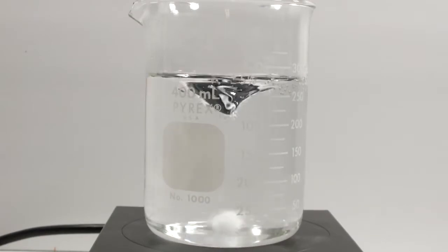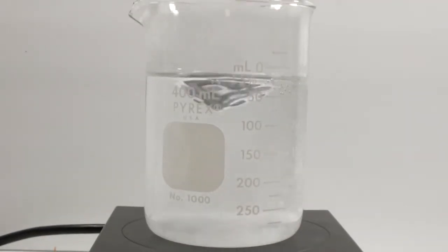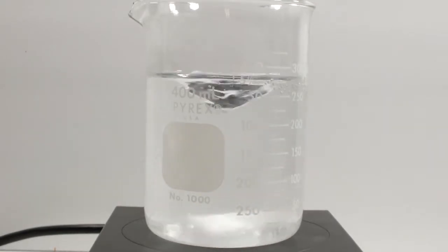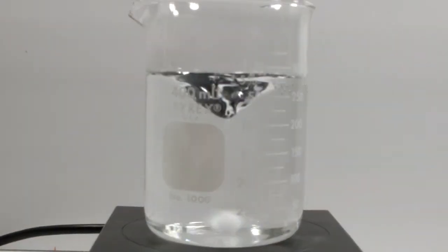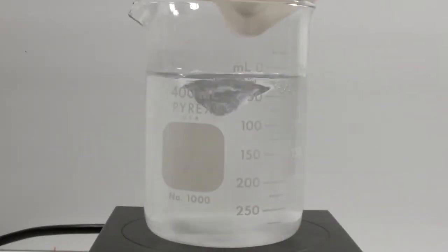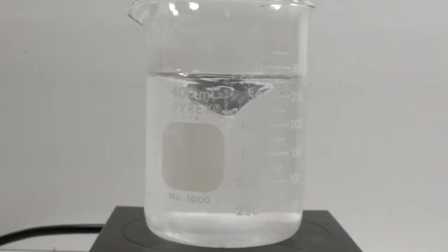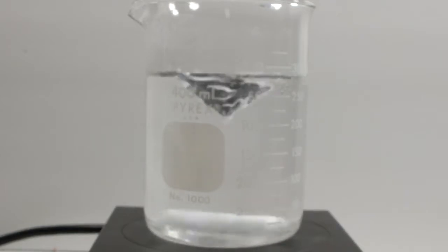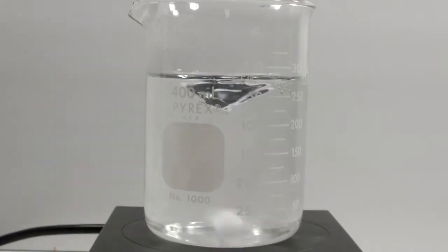The next step is to add 3 grams of malonic acid. And once it's in there, it'll take a minute to dissolve, and once it looks clear, we can continue. Looking good. Next up, the potassium bromate. Oh no, that was the manganese sulfate. The reagents are all good, but this time the chemist is stale. Oh well, let's throw in the potassium bromate now.